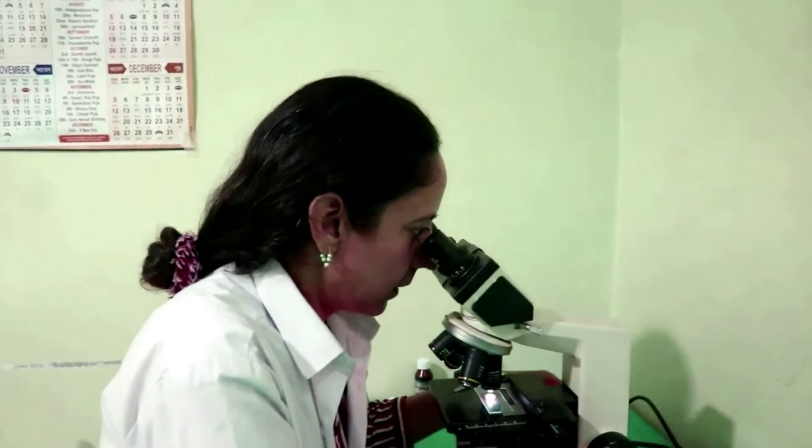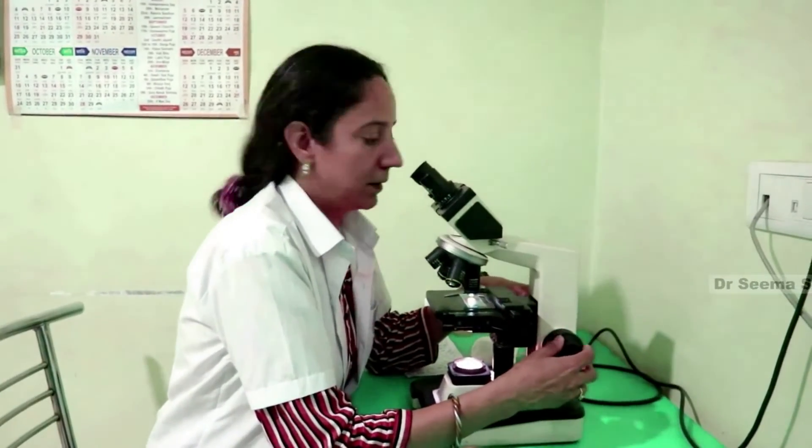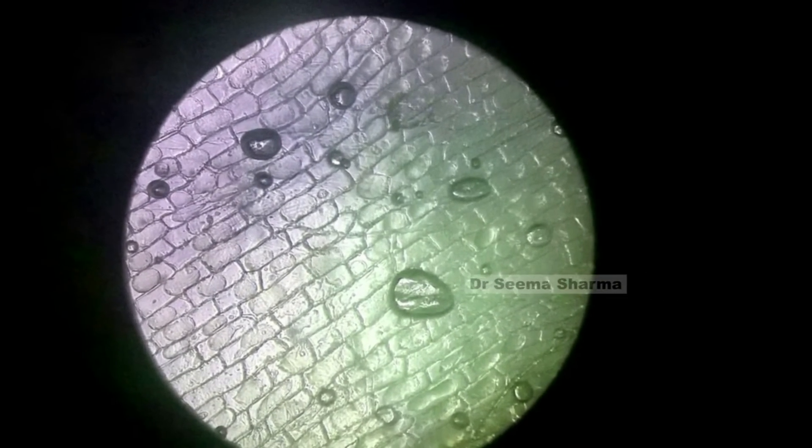While observing the specimen, we view from here through these eyepieces. Initially, the enlarged image of the specimen may appear blurred. So, focusing is done with the help of these knobs for finer adjustment to observe the specimen with clarity. And believe me, once you get the focus right, you have a breathtaking sight.